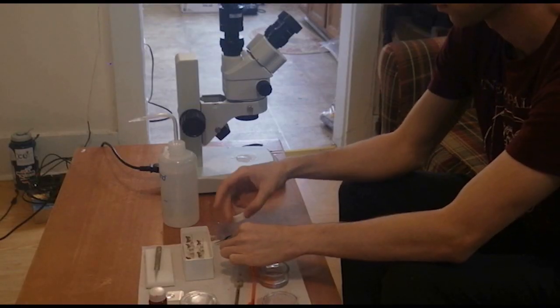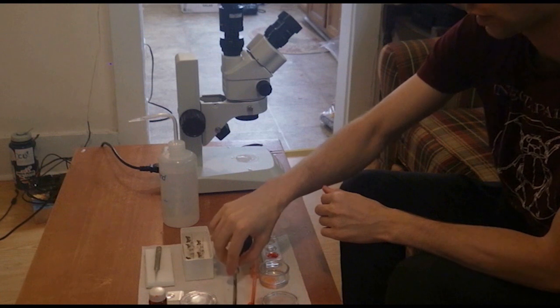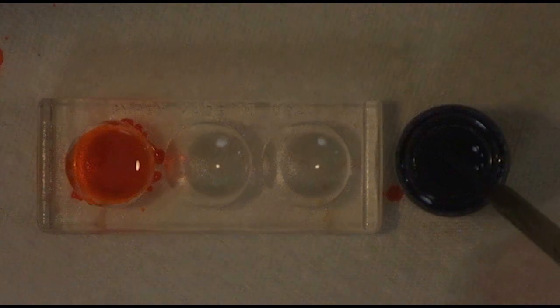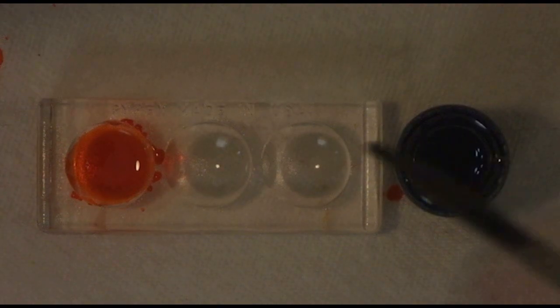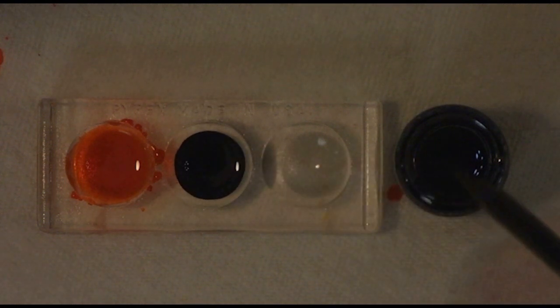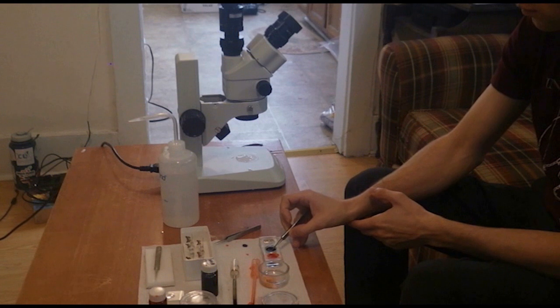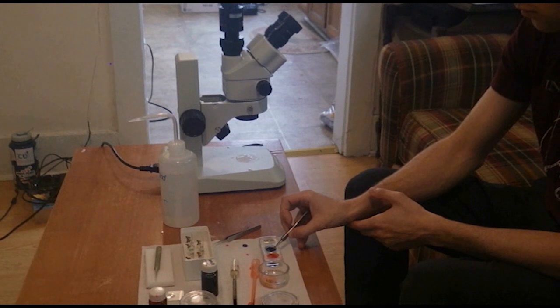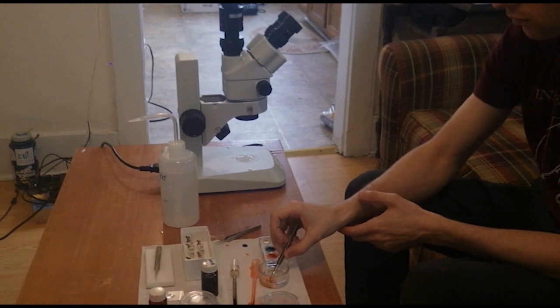I can now add a few drops of chlorazole black to the glassware. Chlorazole black is a much stronger stain and should be treated with extra caution. It stains membranous structures blue. I dip both the abdomen and the genitalia in chlorazole black for about 7 seconds, never letting go of it with my forceps, as they can become almost impossible to find again if you let them go.